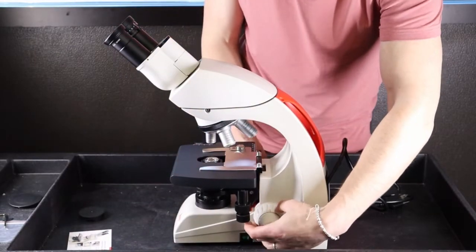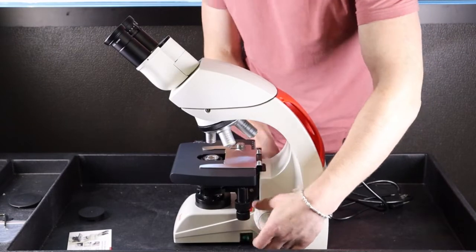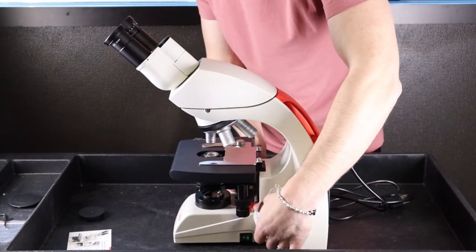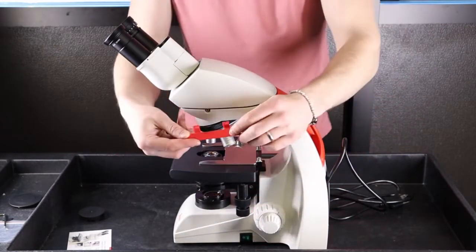You'll take the microscope, bring the focus all the way up, which will give you access to remove the lower travel lock.